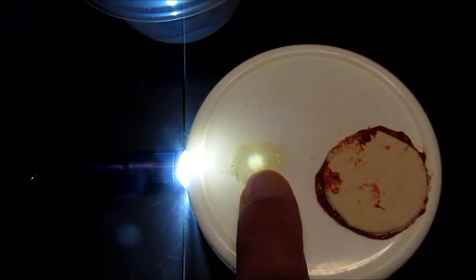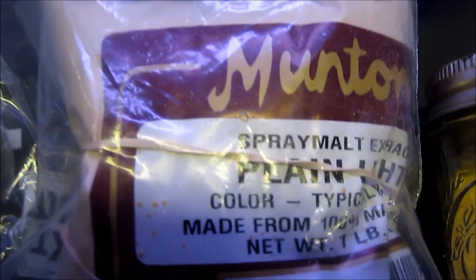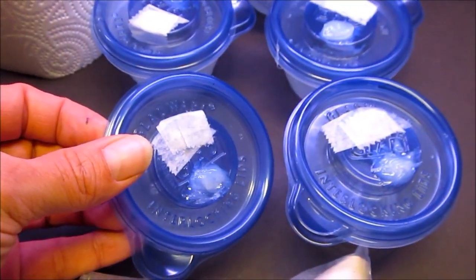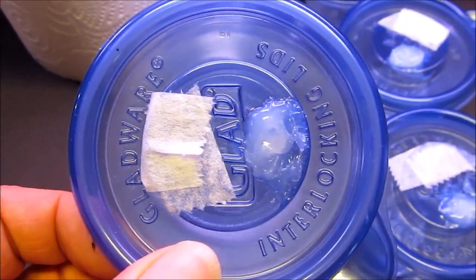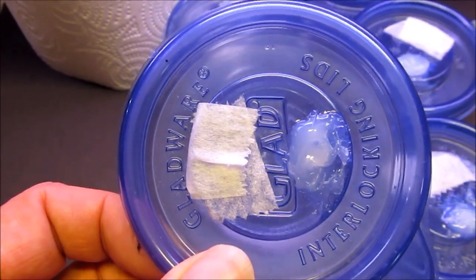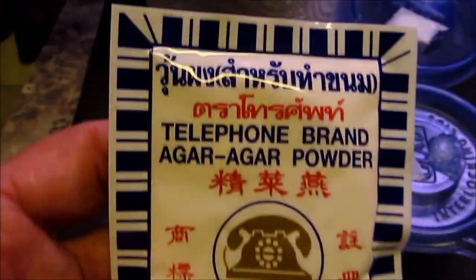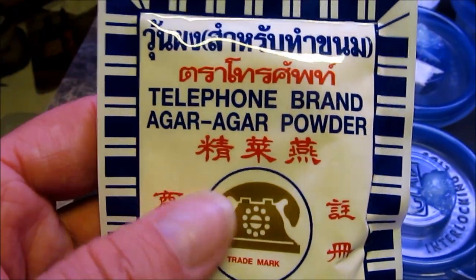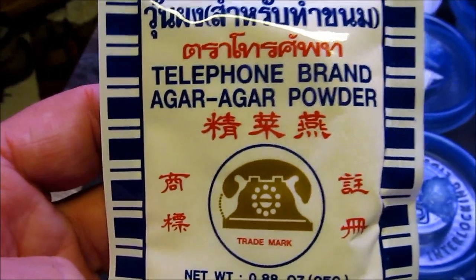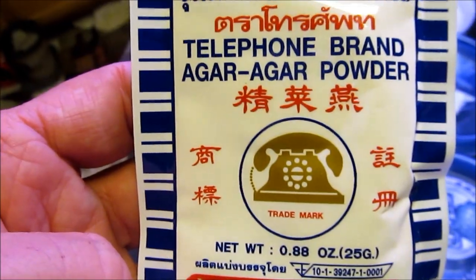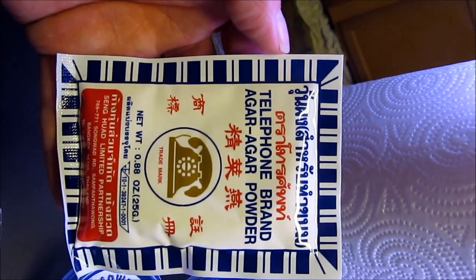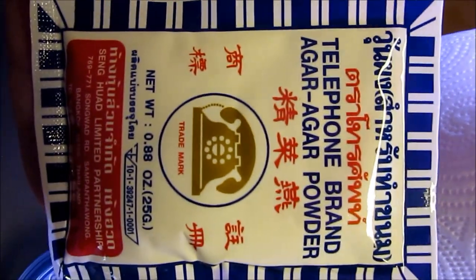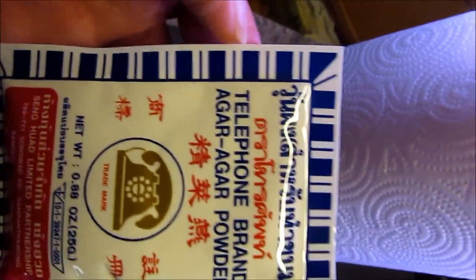Goes on the top of the jar, gas exchange happens through the patch, and then the injections happen through the port. Let's run over some of the supplies here that we're going to be using for the pasty whites easy agar tek. Got your Glad mini rounds with our sweet little custom-made lid - silicone on the right, micropore cloth tape on the left over their respective quarter-inch holes. Then from any Asian grocery store you should be able to find the Telephone brand agar powder. Like a buck fifty, make two or three batches for the Glad round, so it's really cheap.